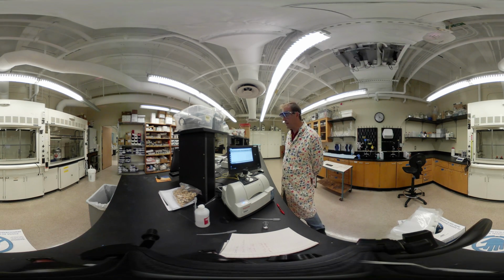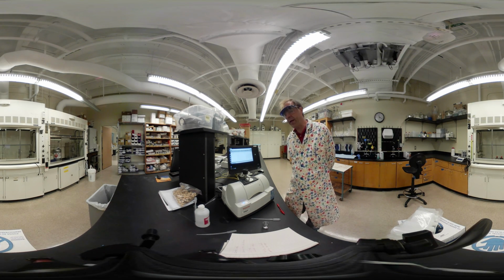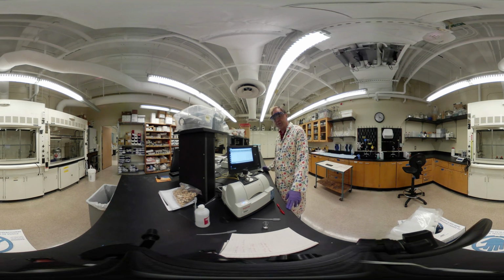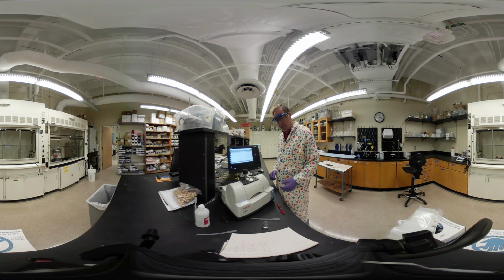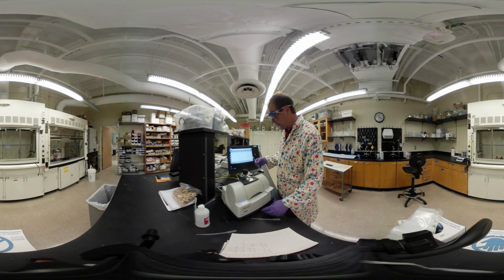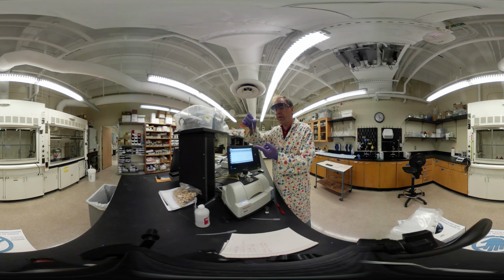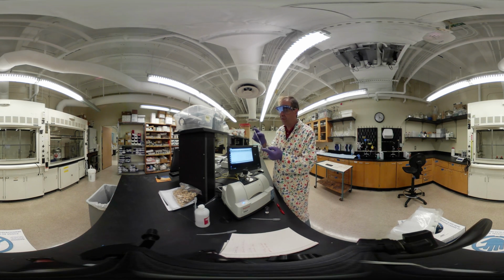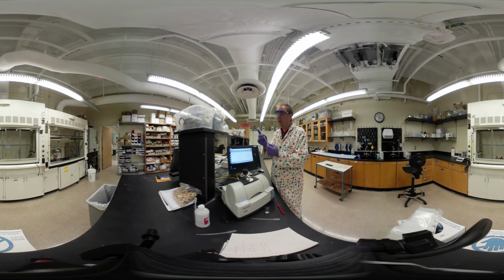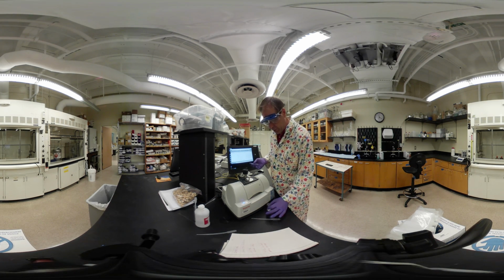Now yours may look slightly different because we have run this experiment several times, and so you will be provided with some data to analyze. The only other test we want to do is NMR. What we have here is an NMR tube. It just looks like a thin glass tube. It's made of a very, very special glass because when this goes into the instrument, it spins very, very fast. It's about $25 each for the tubes. And so we're going to use either the 400 or the 600 megahertz spectrometer for this.